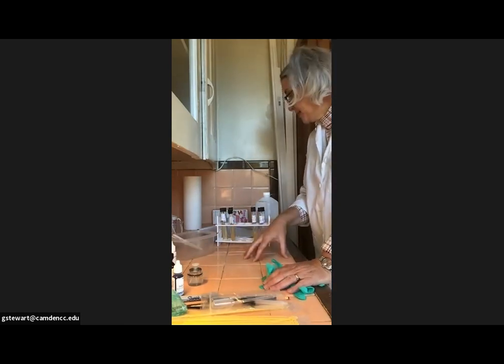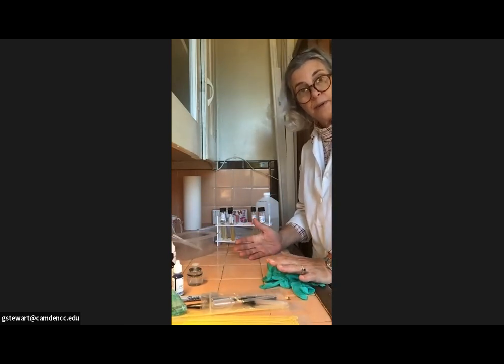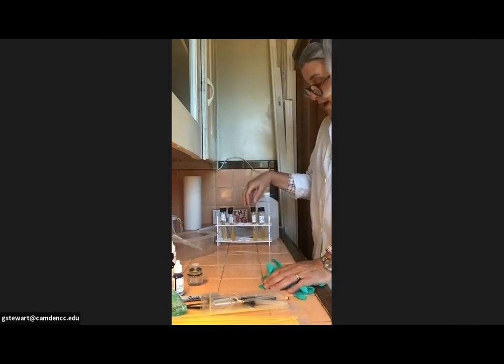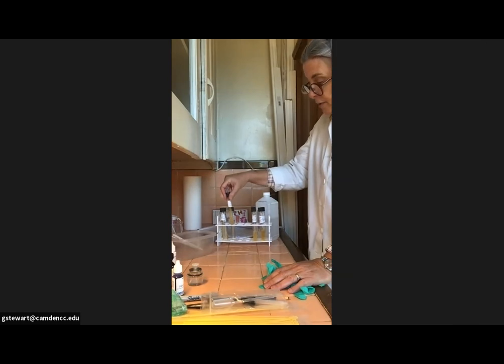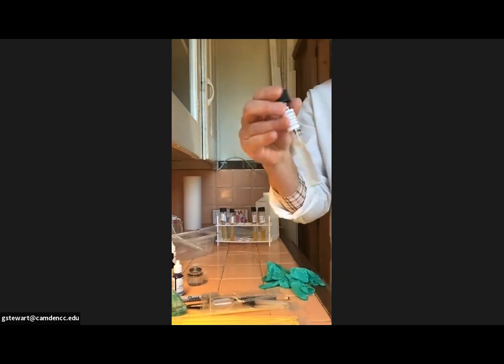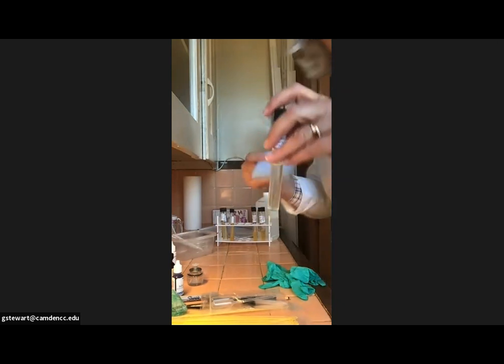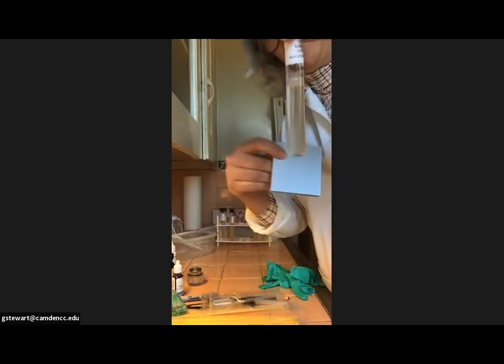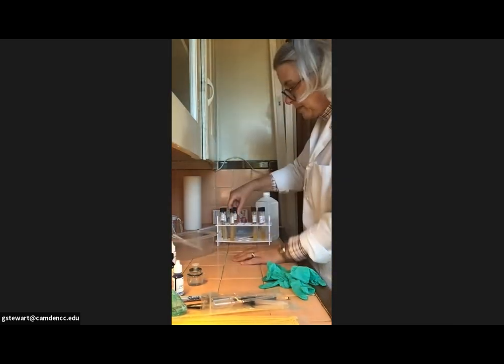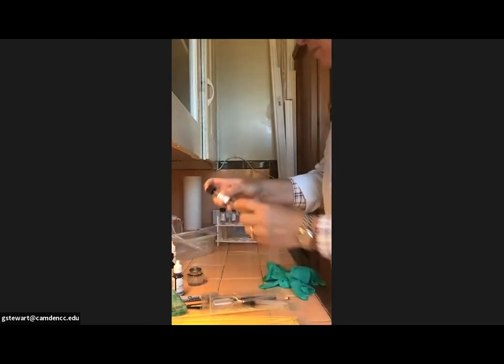The second thing that we need to accomplish today is we need to take a look at our results from yesterday to see if everything's grown up enough that we could record our results. My results did not grow up well enough. So I can see a lot of growth in my broth culture, and I should probably put that behind a dark background, which I don't happen to have with me right now, but yeah, not too great. But you can see that it's cloudy, hopefully. So the broth cultures look great. The slants look pretty good, but the cultures are a little bit light.